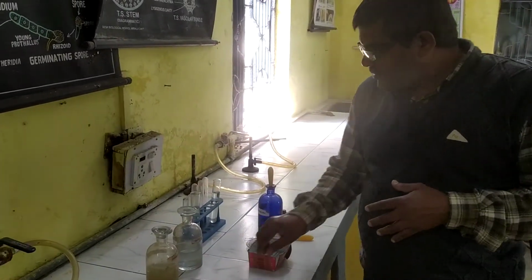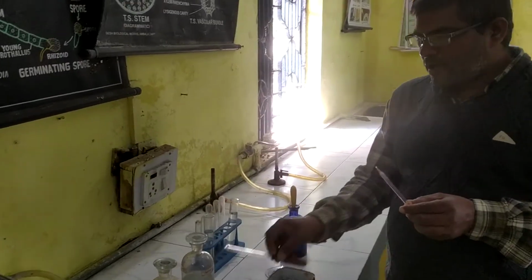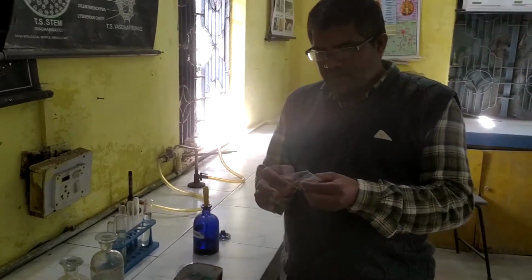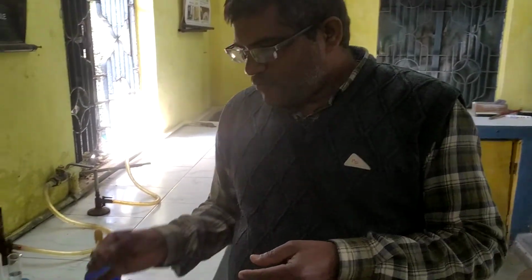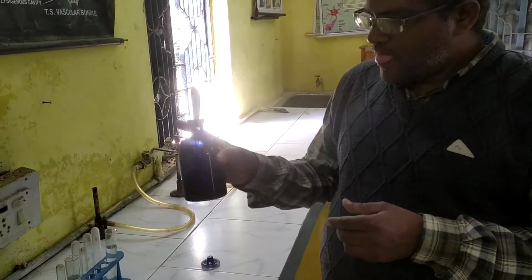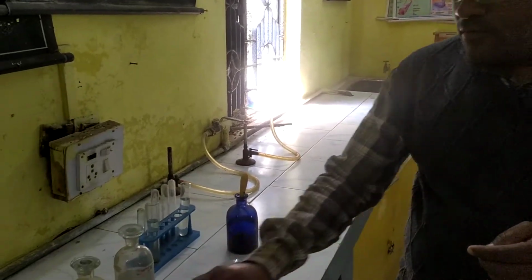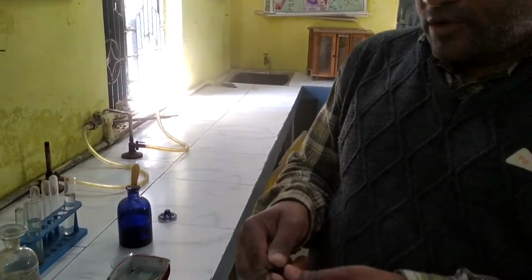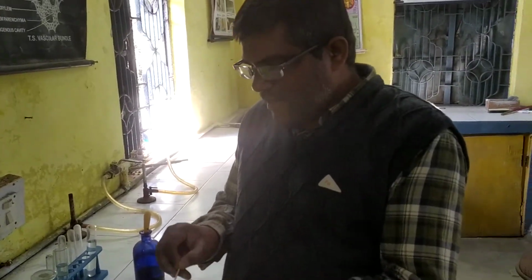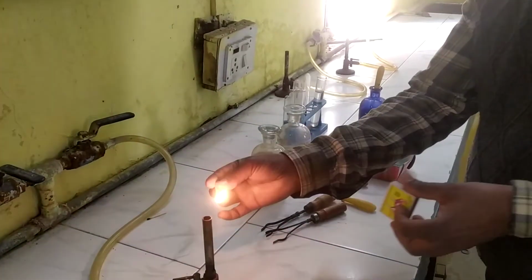We have some droppers for taking the water sample. We have the plain slides, this type of slides, where we will perform the experiment. Then we have the methylene blue stain. These are the test tube holder, and we have the gas or spirit lamp that can be used for this purpose. So these are the basic requirements: collected water, dropper, slide, methylene blue, etc.